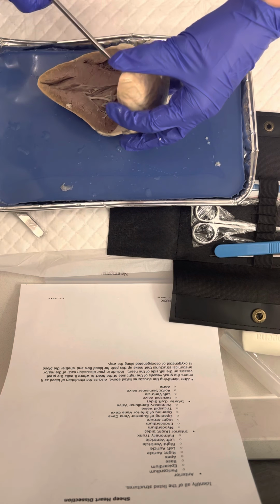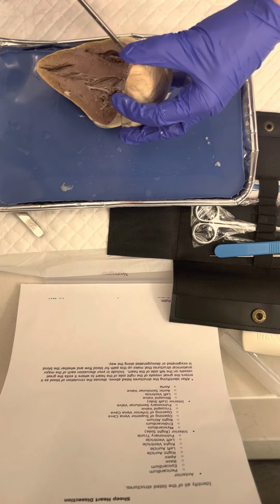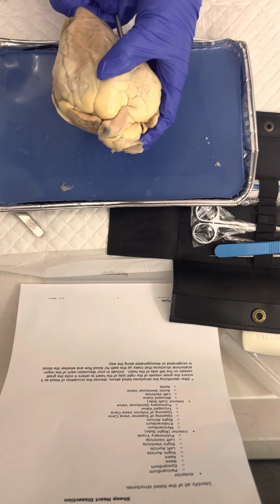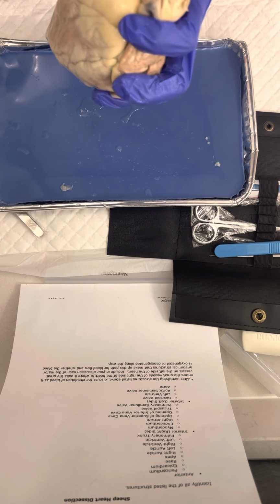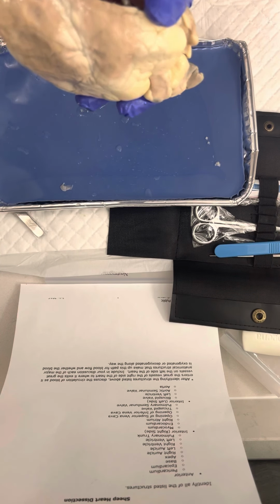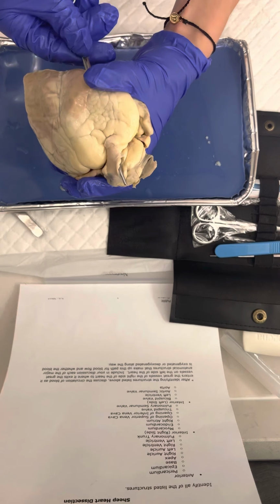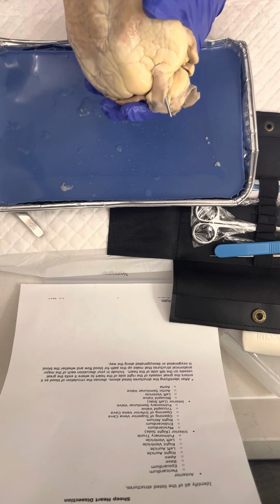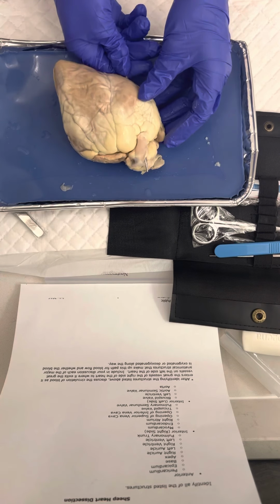blood will leave the heart through the pulmonary valve. So let's go up through here, and it'll come out through the pulmonary valve. Okay, well, that should not be coming out like that. Okay, there we go. It'll come out the pulmonary valve, and then into the lungs, and the lungs will be oxygenated.